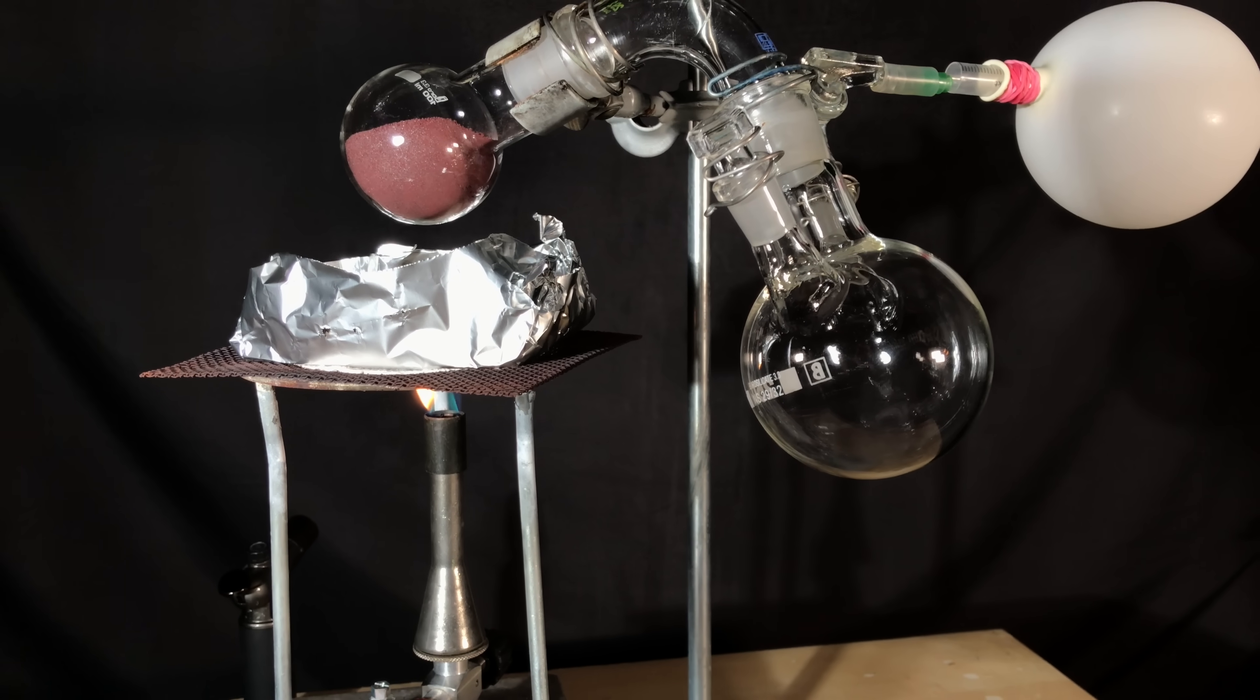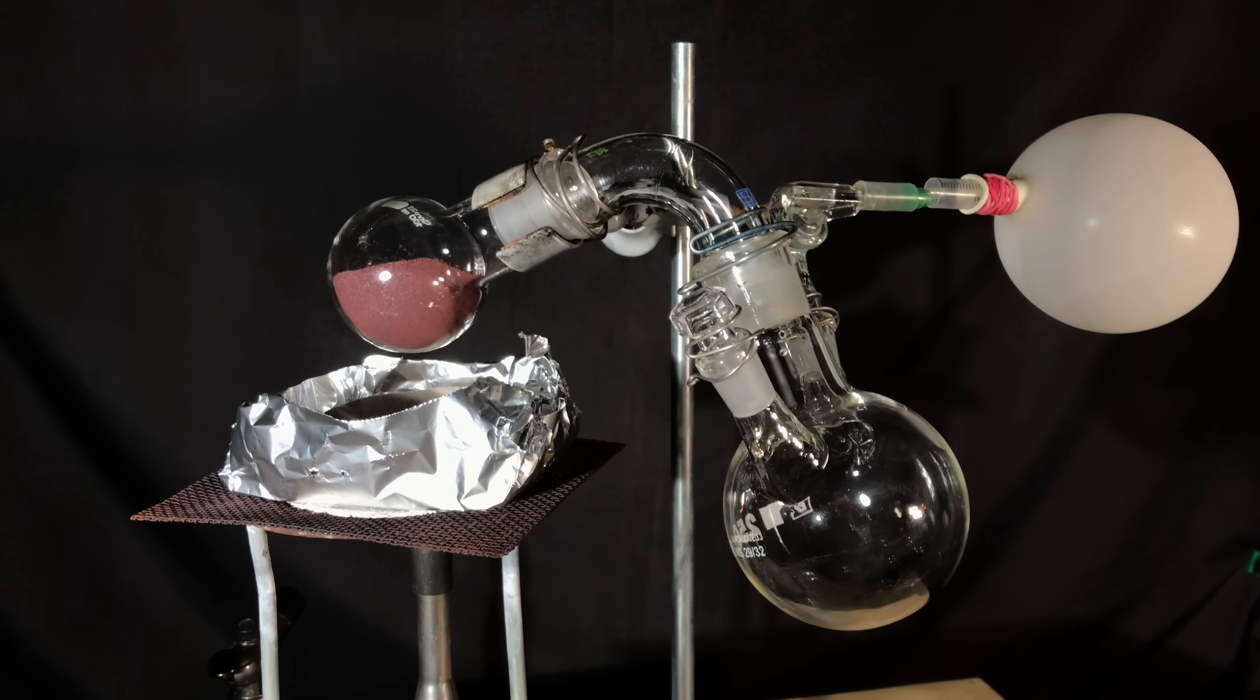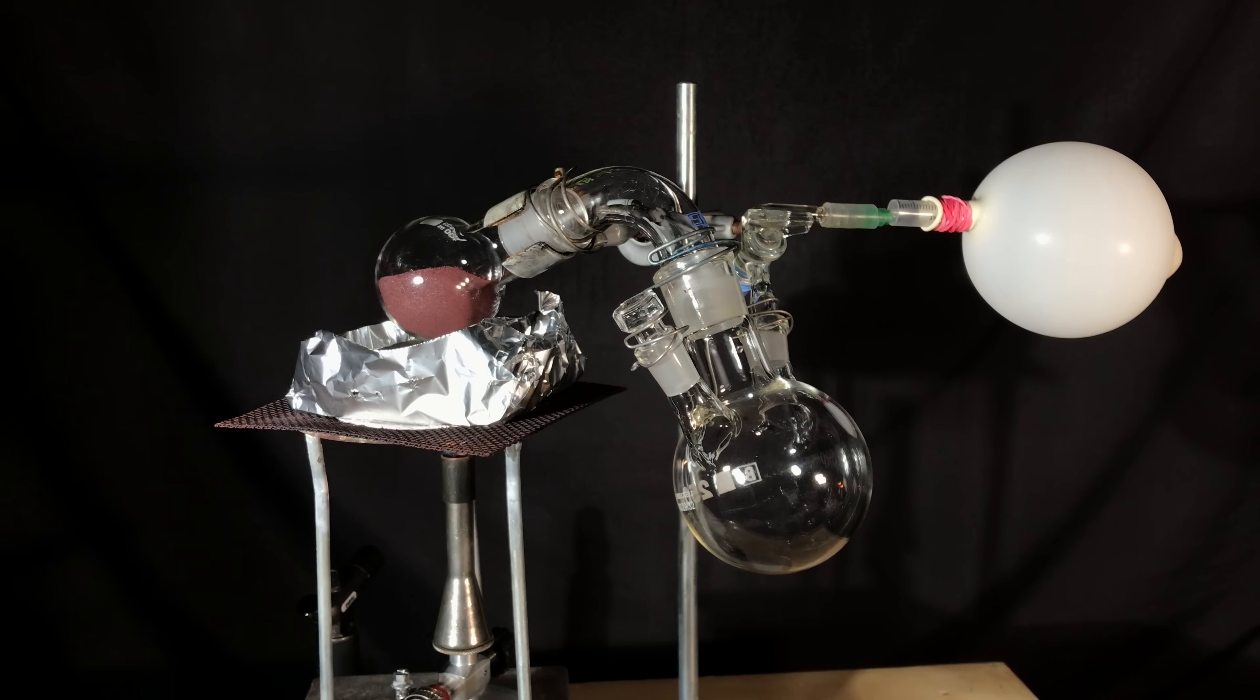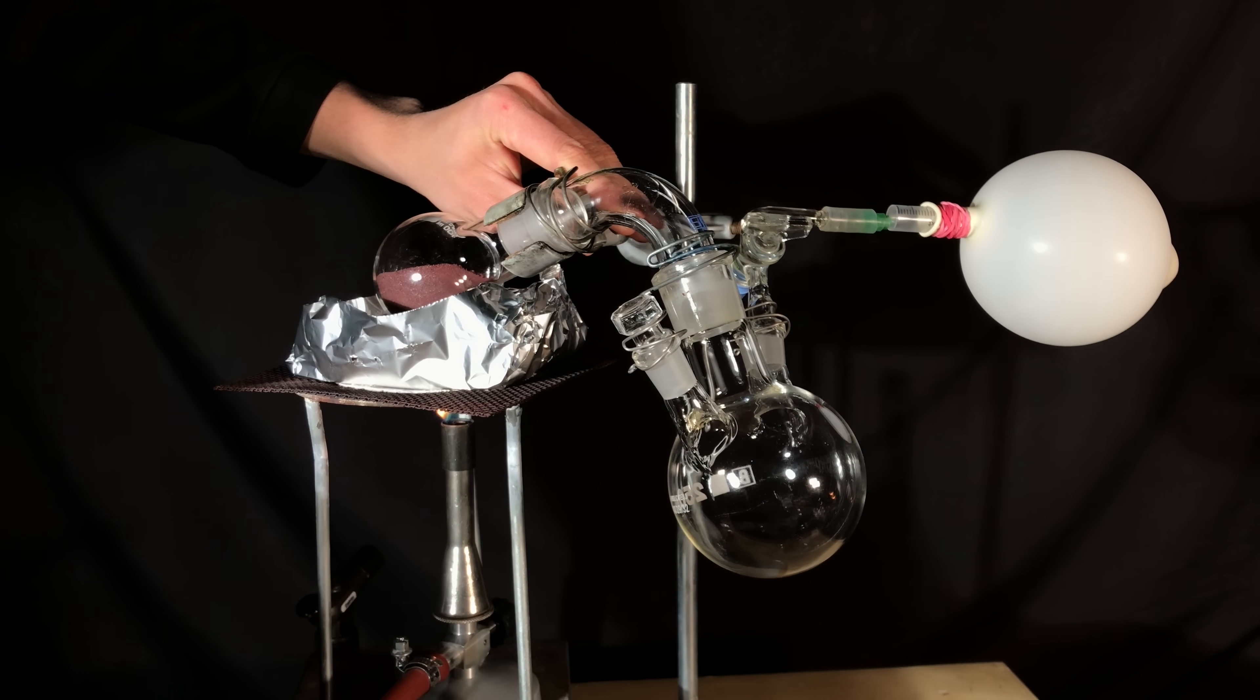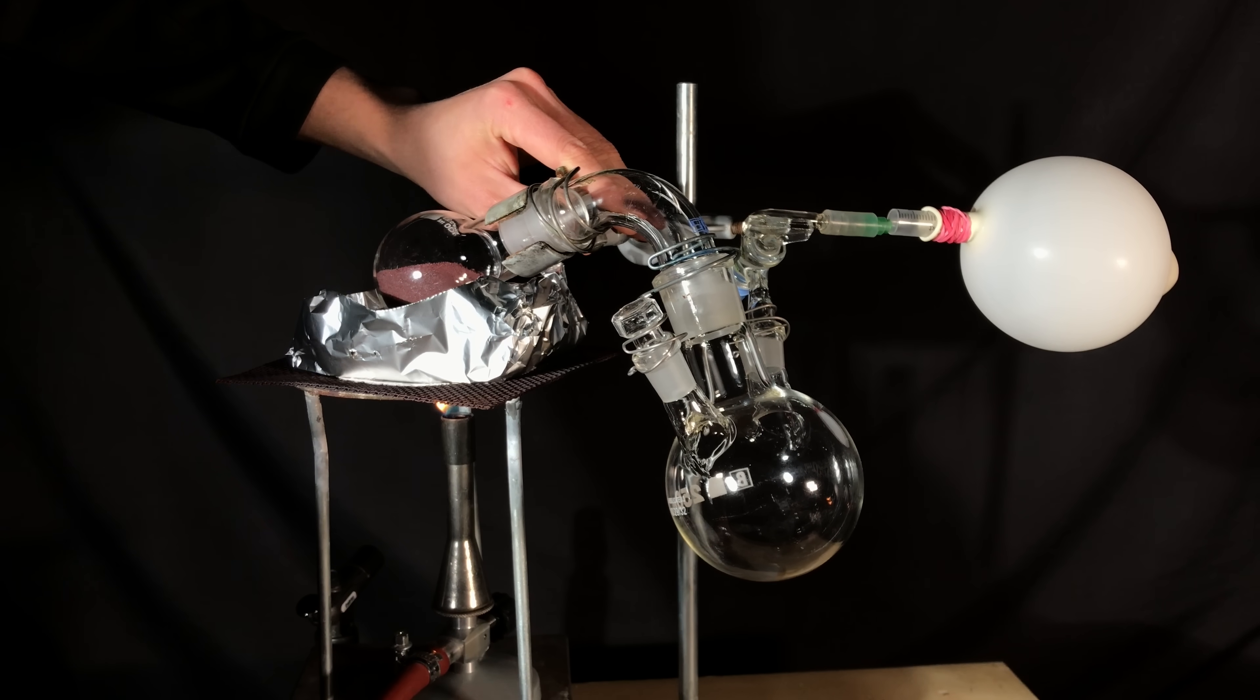Here you can have a closer look at our beautiful apparatus. All you need to do to convert red phosphorus to white phosphorus is to heat it up using a Bunsen burner. The red allotrope will simply convert to the white allotrope, which will boil over.